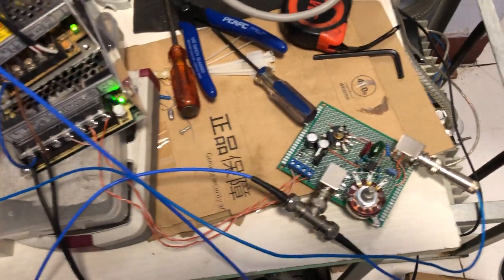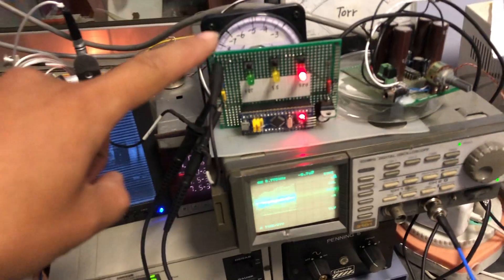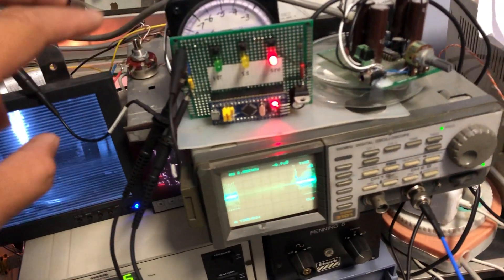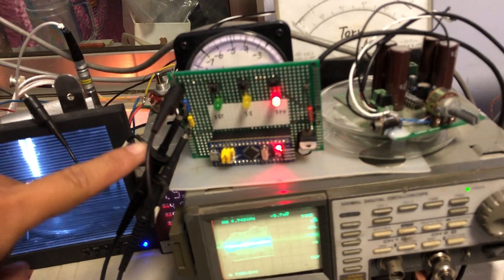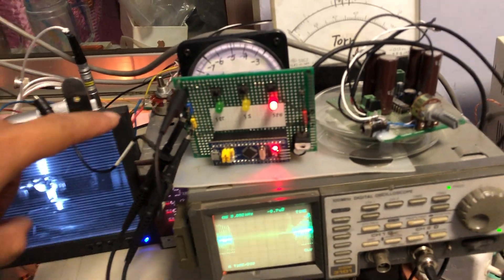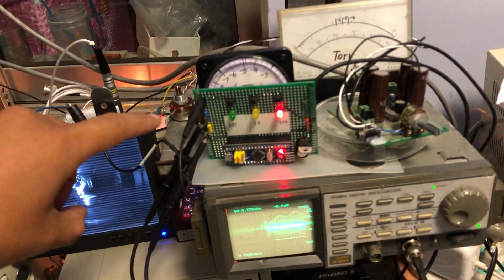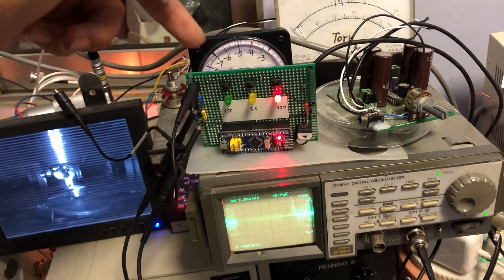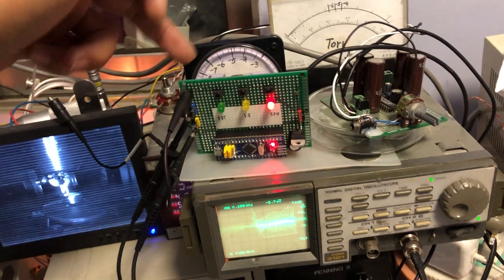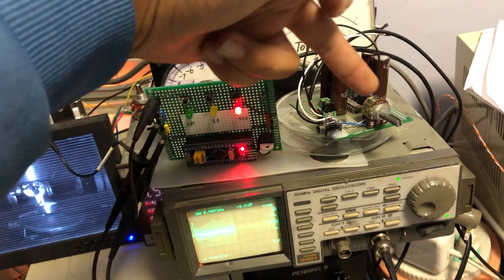Okay, so the scan signal is split in two parts. One part is going to the amplifier.